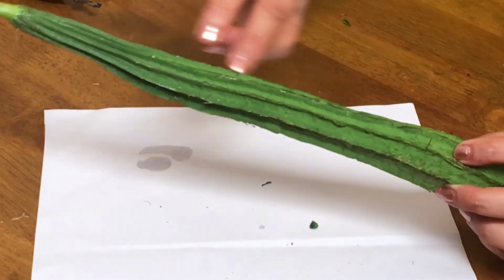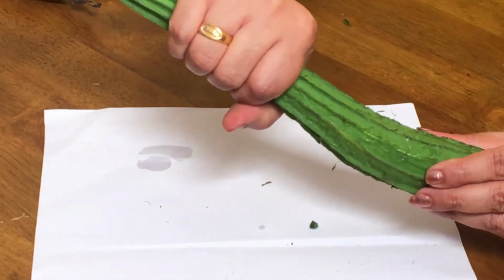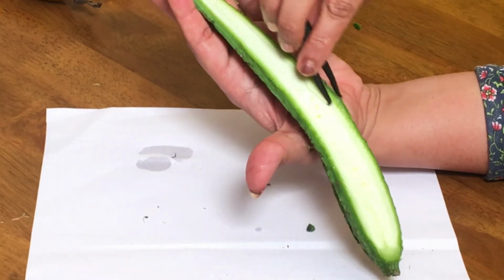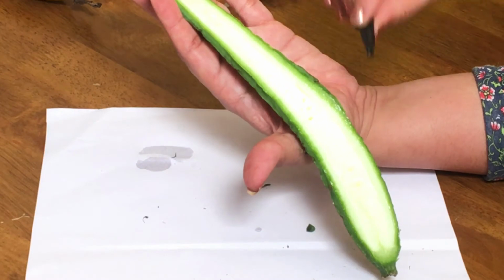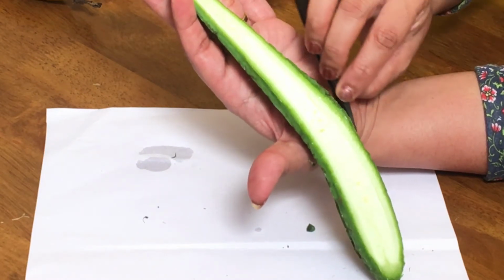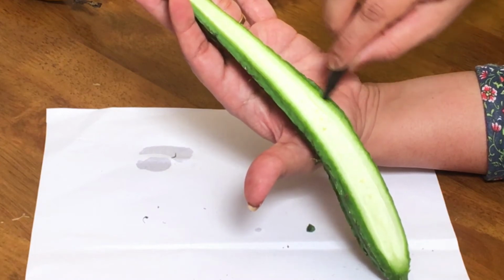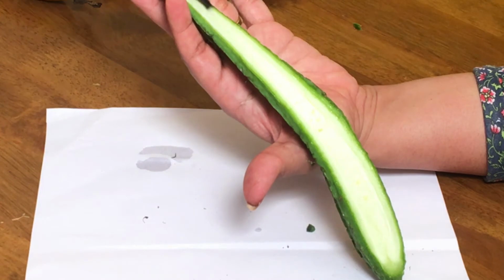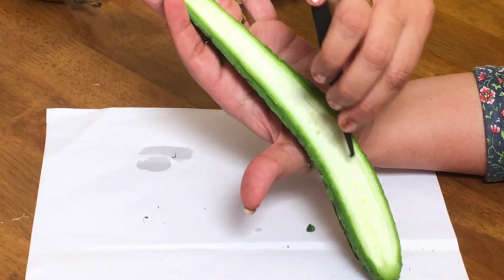These ridges and this green area is the ripened ovary wall. This green and white part together constitute the pericarp, where the green, outer area is the epicarp, that peel. This green, soft, fleshy area is the mesocarp, and the white cushion-like region is the endocarp, and inside, seeds will be there.